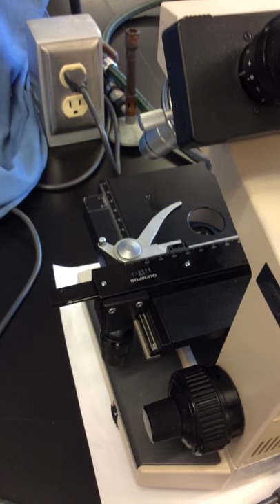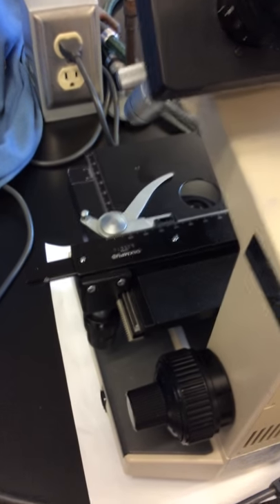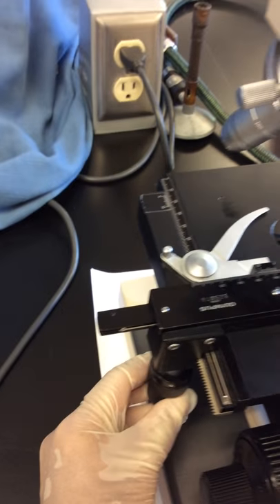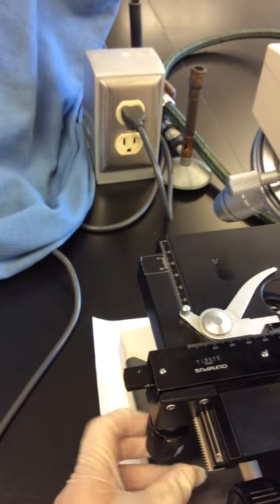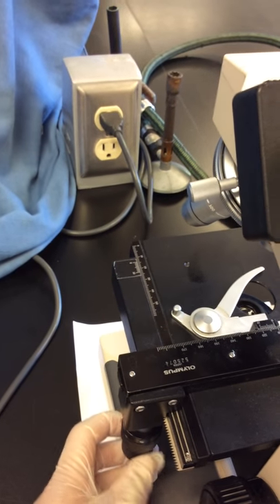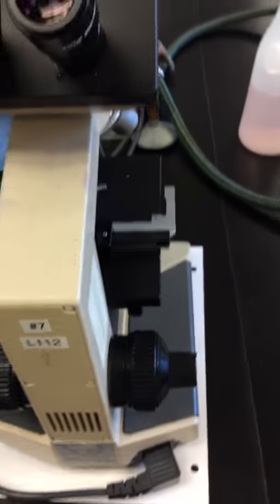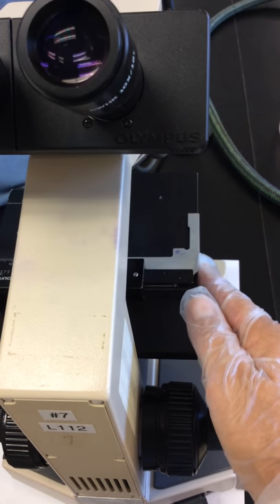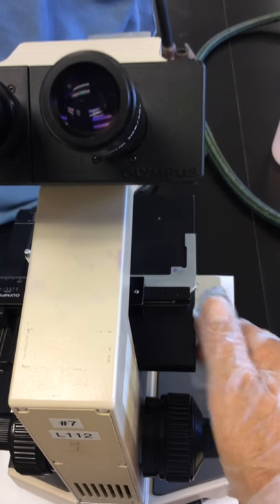If we put that back in the microscope cabinet, it'd be easy for it to be bent. So what I want to do is make sure that I can center the mechanical stage so the arms aren't sticking out beyond the stage. I'm just going to make sure that this part of the mechanical stage is flush with the stage.